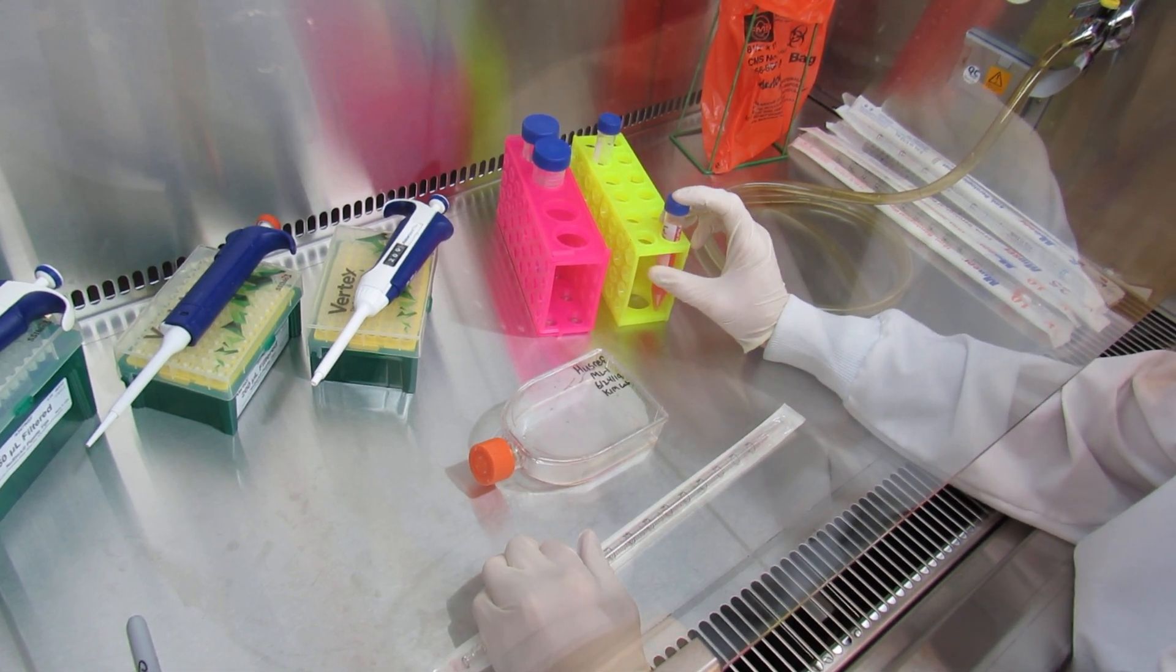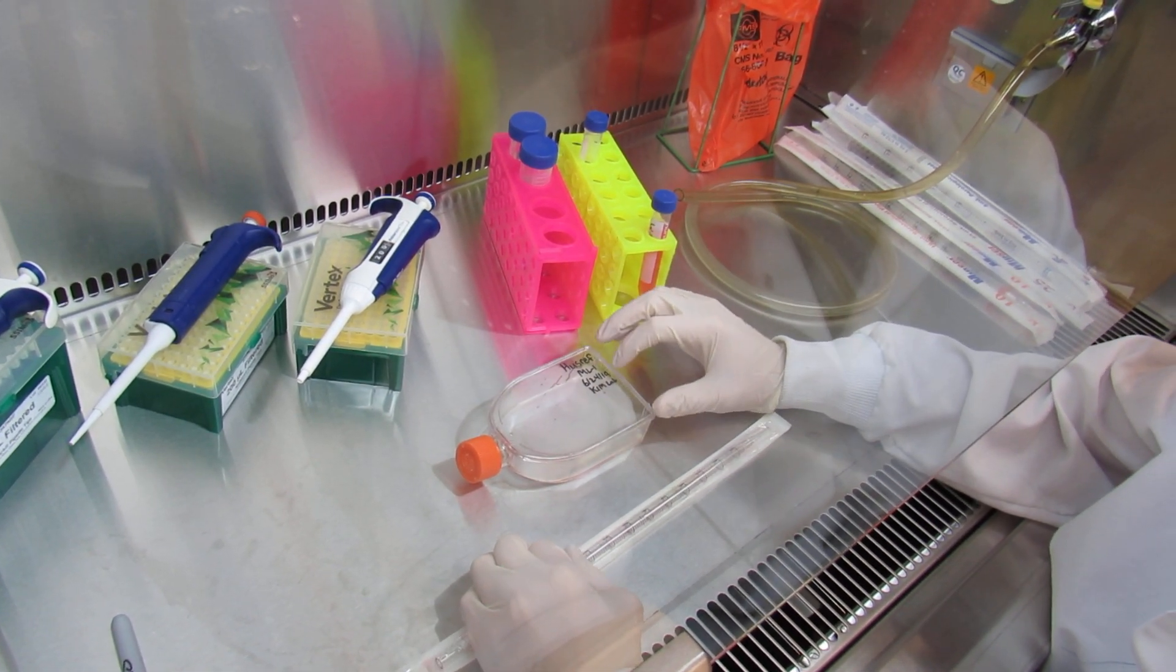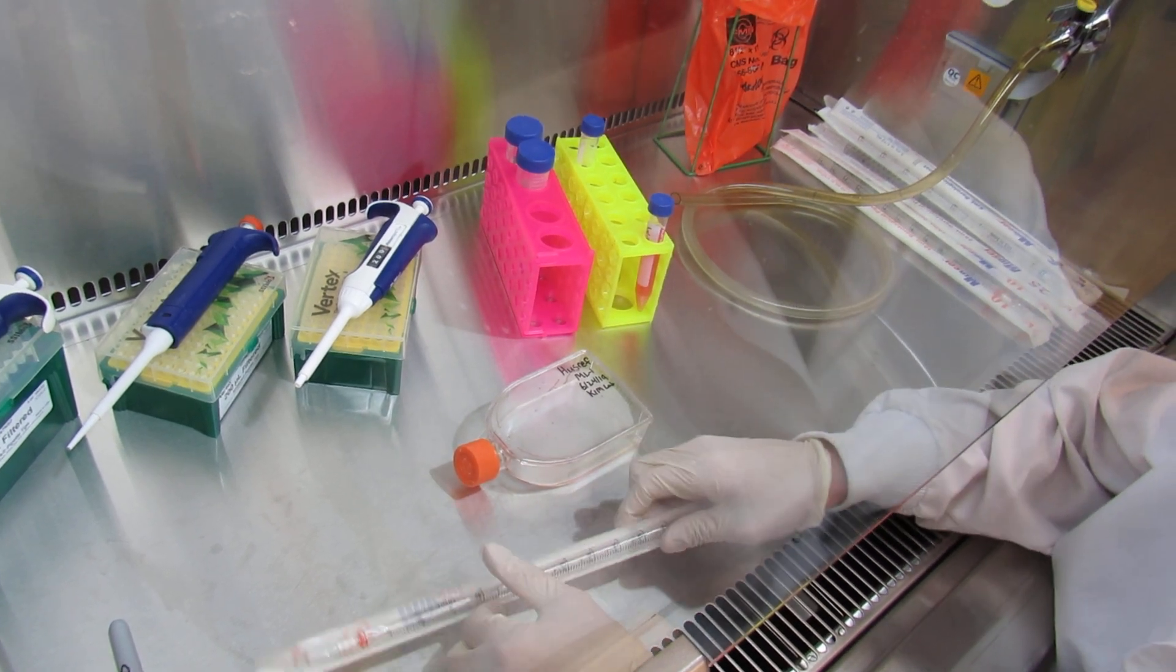For this, we will add 12 milliliters of media to neutralize it. However, you'll only be doing around 5.5 to 6 ml when working with a smaller flask.